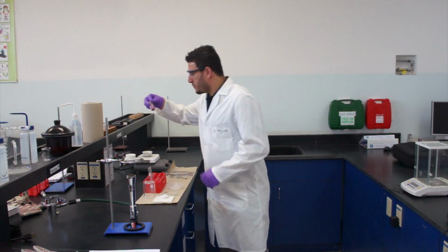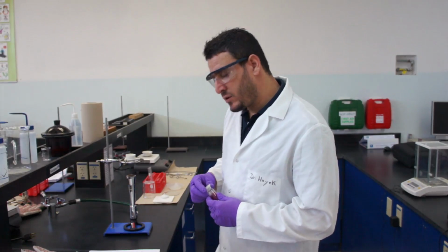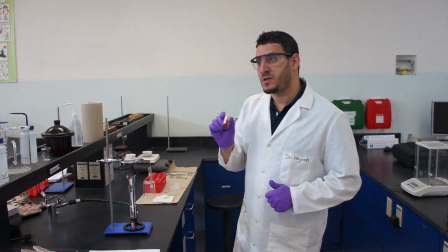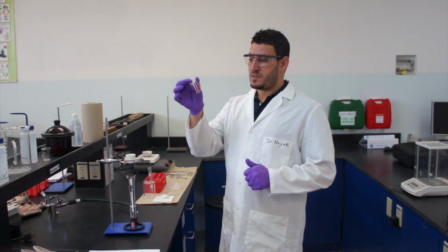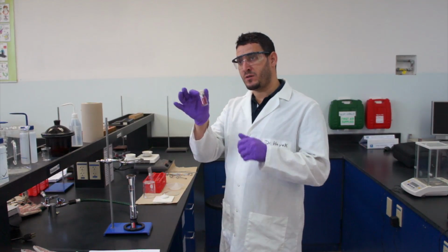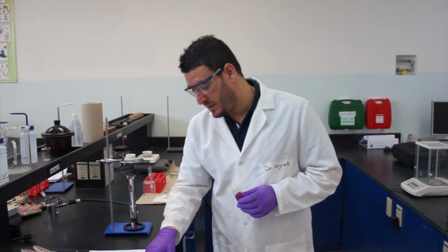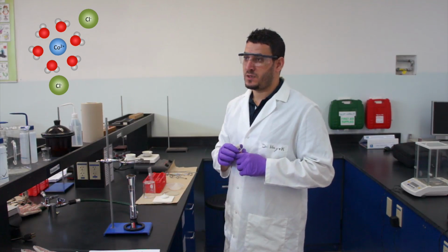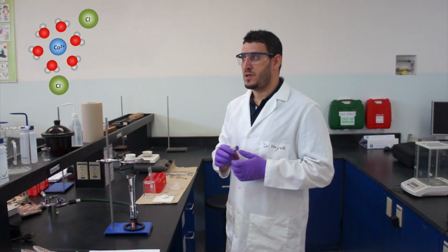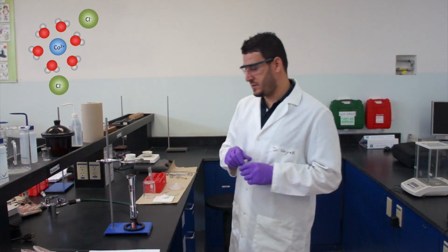Now what we have to do is take the cobalt chloride hexahydrate. So this is a hydrate. You remember what a hydrate is? This is an ionic compound, an ionic solid, where there are how many? 6 water molecules around each cobalt ion, surrounding it. So this is what it means, cobalt chloride hexahydrate.